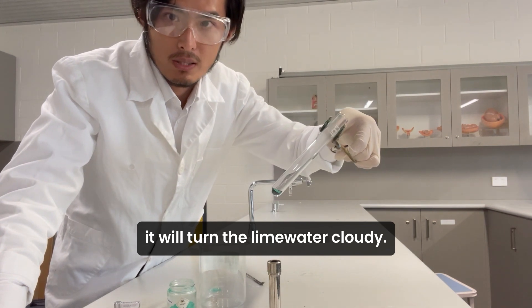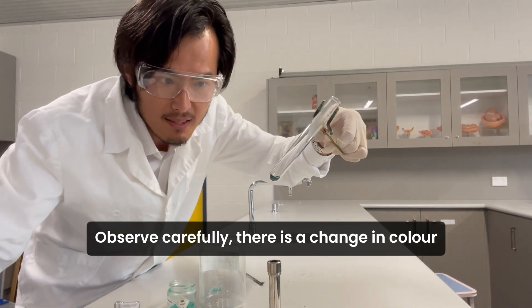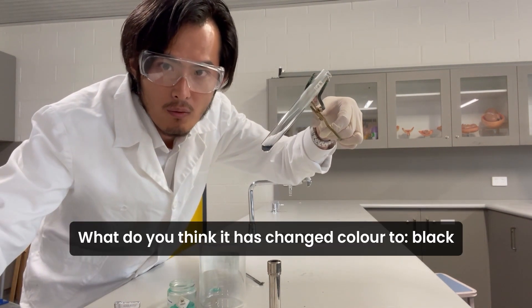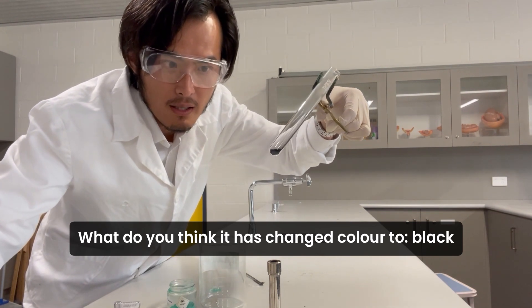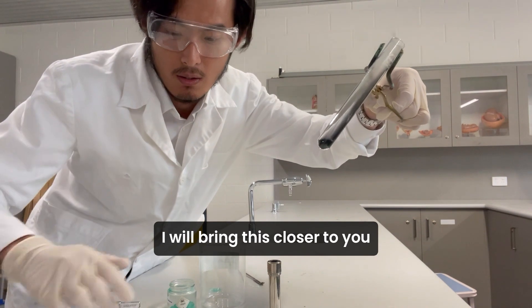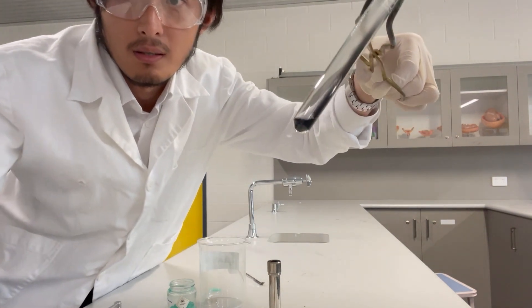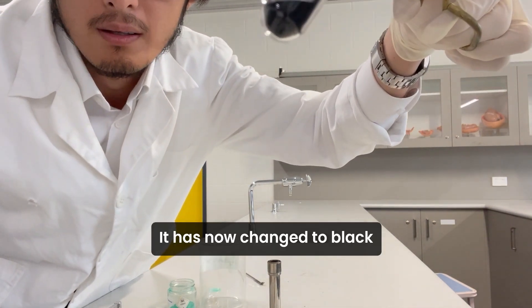Can you observe it? Look at this — it's changing color. What do you think it has changed to? Can you see it's turning black? I'll bring this closer to you. Now turn off the Bunsen burner — it has now changed to black.